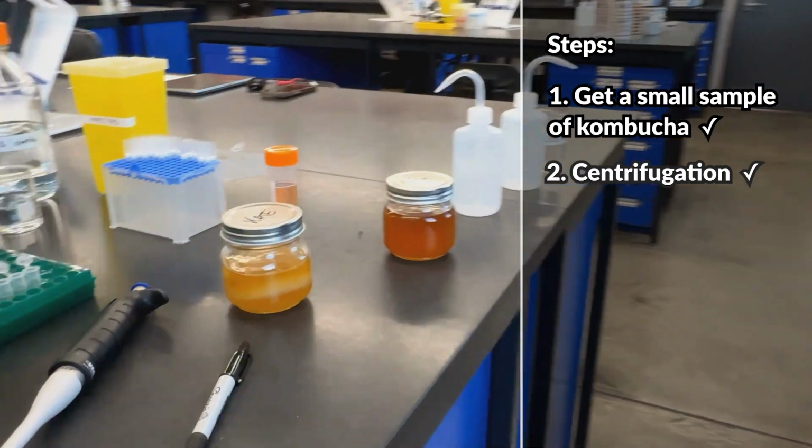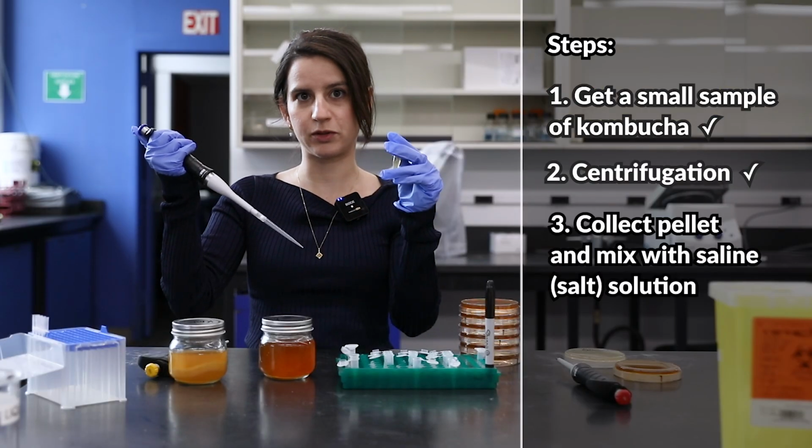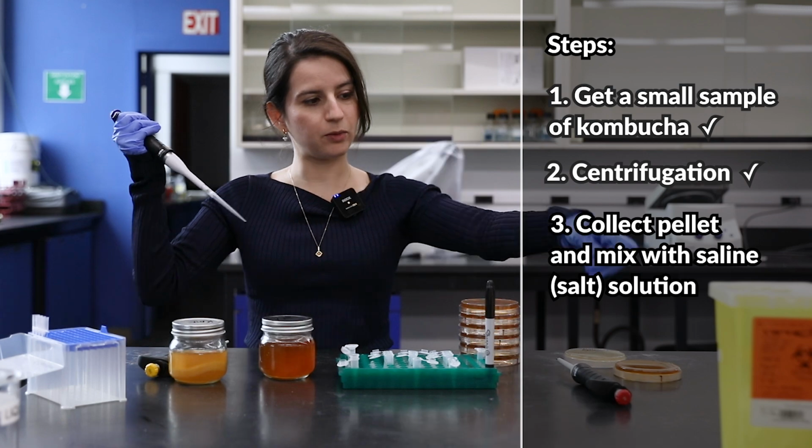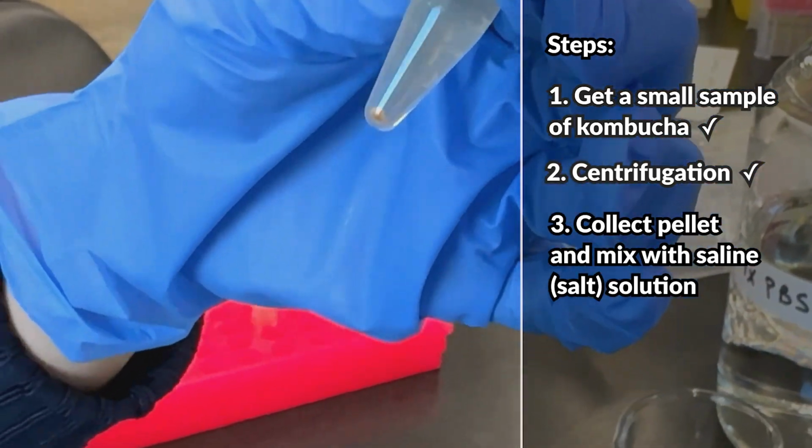The next step is to take out the excess liquid and leave the pellet, which forms during centrifugation. Then we add a little bit of saline water or salt water to help resuspend the pellet.